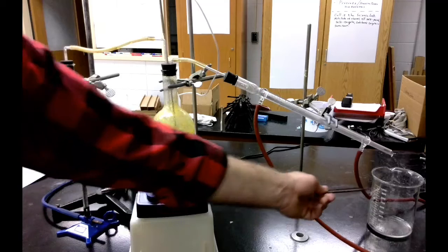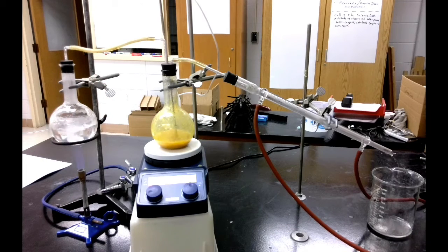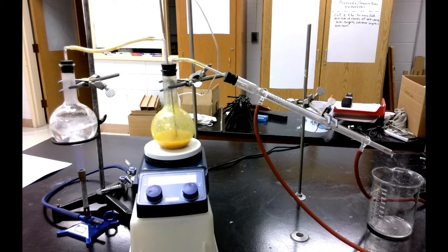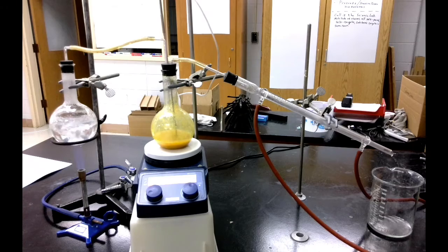And so we're going to be collecting a thousand milliliters, one full liter of our water and limonene oil mixture, and then later on we'll go on to separate that using a separatory funnel.